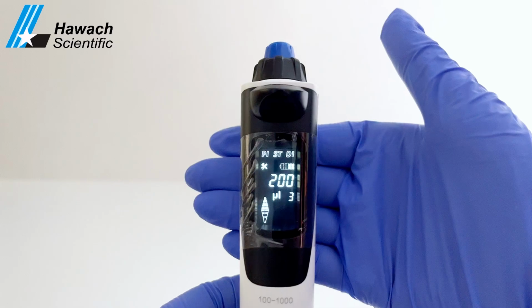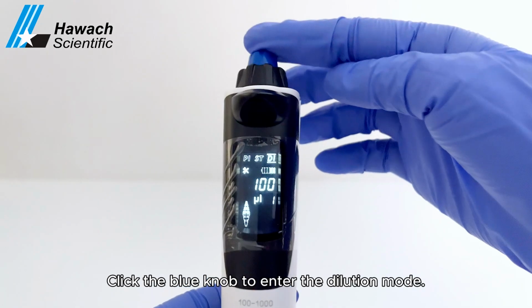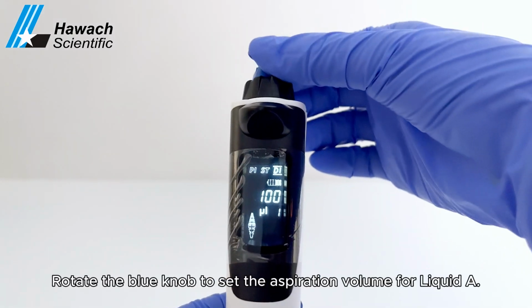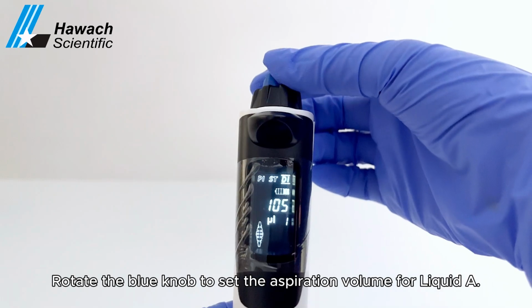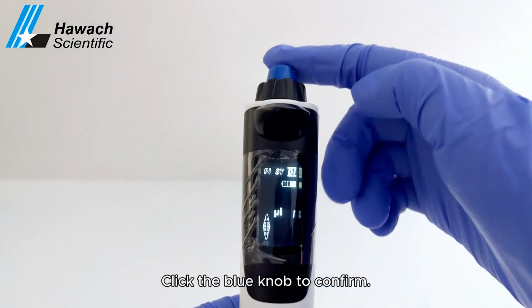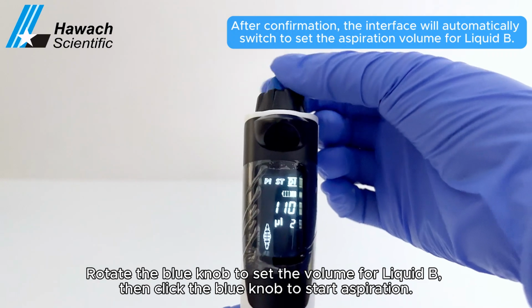Dilution mode. Rotate the black knob left and right to select dilution mode. Click the blue knob to enter the dilution mode. Rotate the blue knob to set the aspiration volume for liquid A. Click the blue knob to confirm. Rotate the blue knob to set the volume for liquid B.